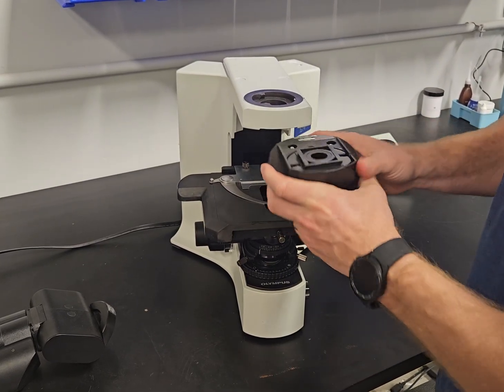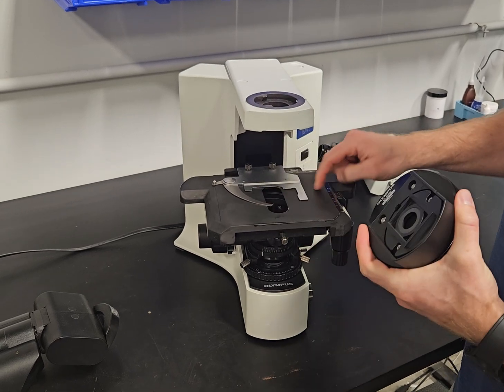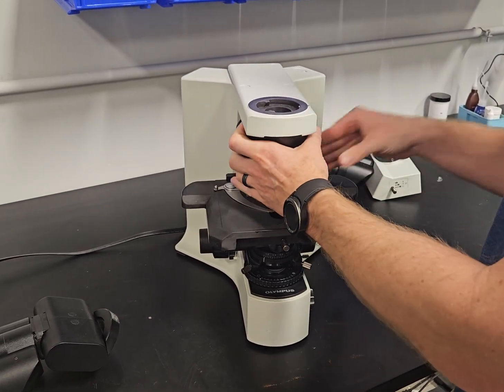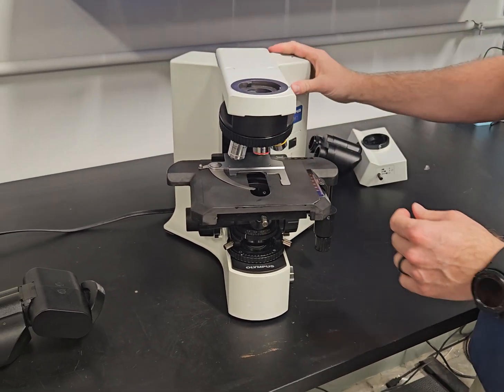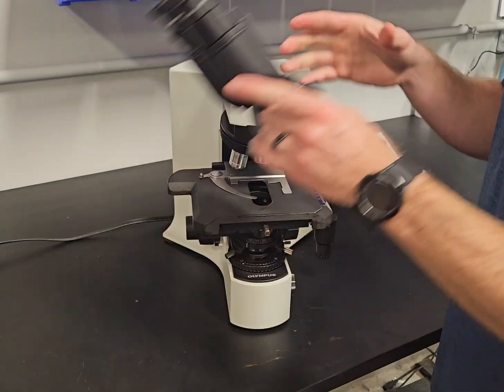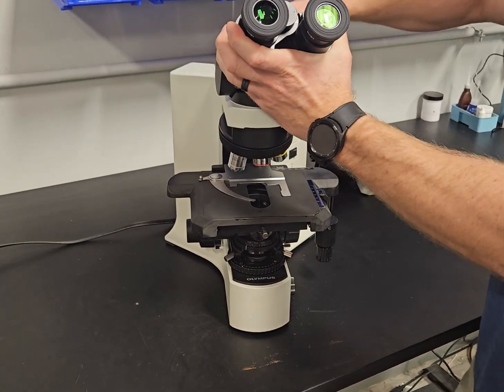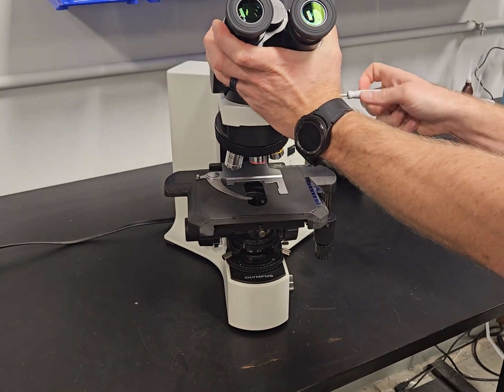Another thing when you're taking these nose pieces or this nose piece and objectives on and off, I always lower this stage and hold this thing with two hands. I'm really comfortable with it. I've done it a bazillion times, but I always want to make sure I hold everything with two hands if I can.